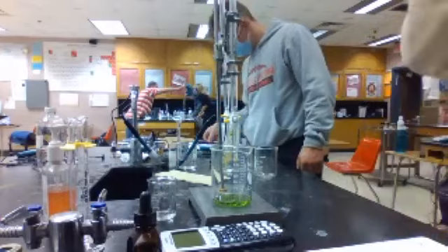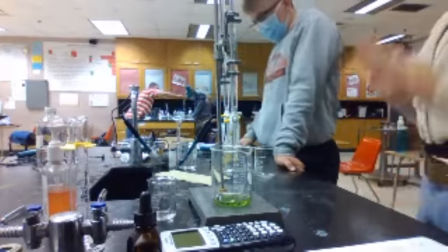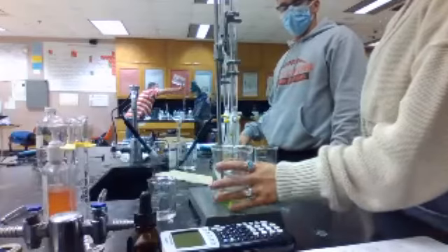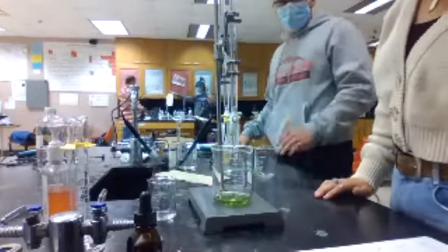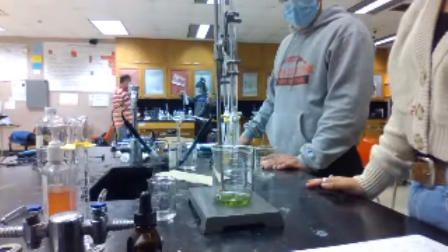Okay, let's do it. Okay, that was stressful. So then we take 23.78 minus 11.78. That tells us... okay, so now what do we do? I never want to do that again. Ever. Okay.